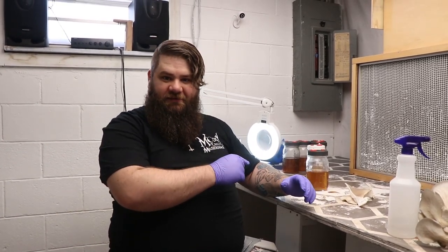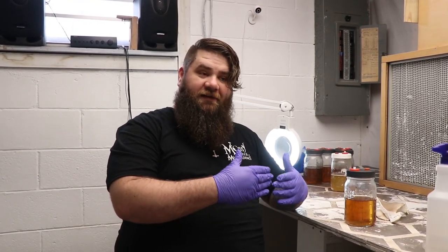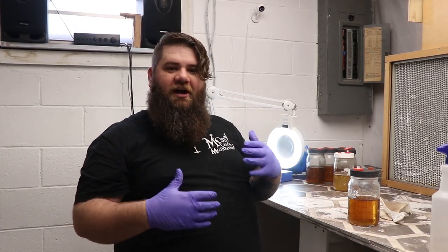Once you're finished getting your piece of tissue inside the jar, you want to take your jar and place it on your magnetic stirrer, or however you're aerating — whether it be a marble in the jar or whatever. I prefer the magnetic stirrer because they do all the work for you and make less of a mess. The reason you're doing this is to allow carbon dioxide to be released from the water and allow oxygen back in — much like a bubbler on a fish tank. This keeps the mycelium from running out of available oxygen. When you pressure cook these, you cook all the available oxygen out of the liquid, so you need to stir these as soon as you put tissue in so they can be oxygenated. The more often you can stir this — if you can stir it every day or have it just lightly stirring all the time — you will get faster growth. That's how I've been able to go from a small piece of tissue to a jar full of mycelium in 10 days.